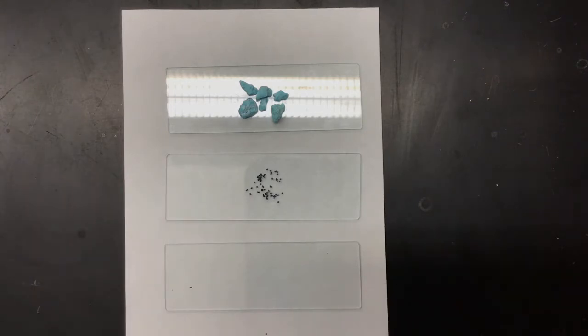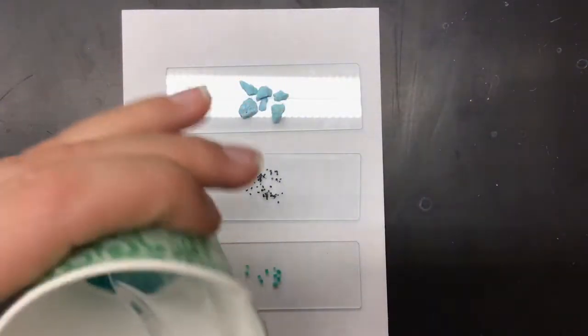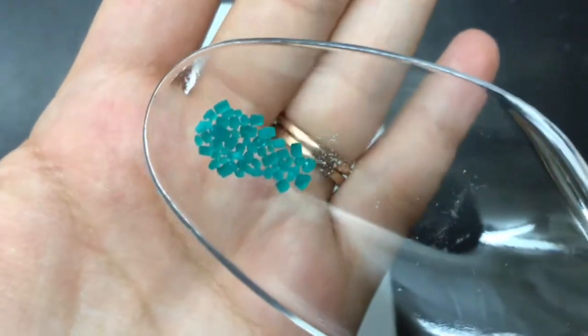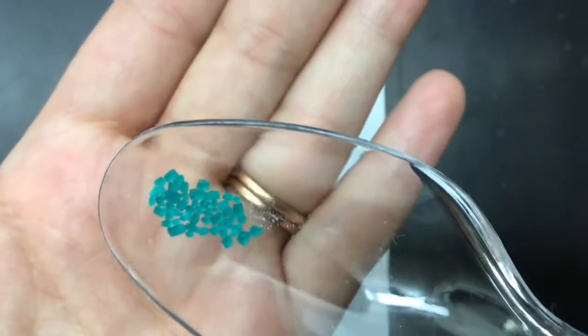Again, I'm only going to use a couple of grains. Separate them out, make sure there's no overlap. Just like last time, I'm going to show you what the grains look like up close. I'm going to get my camera into focus, there we go. So you should be able to get a sense. Again, this texture is a little bit thicker than salt, but it's similar, where I could rub my fingers through it.